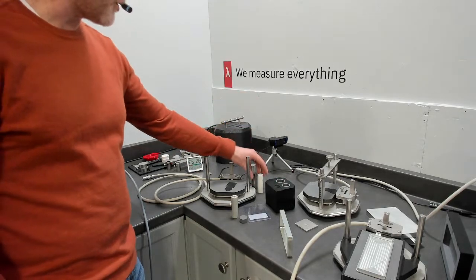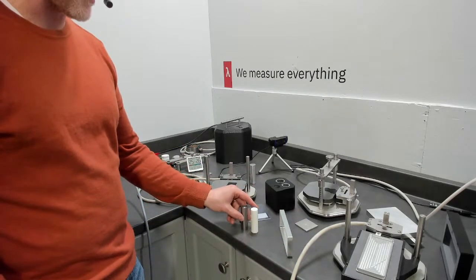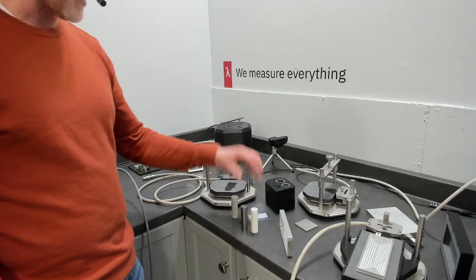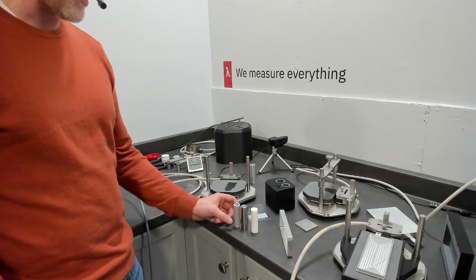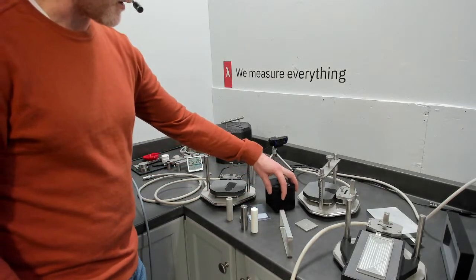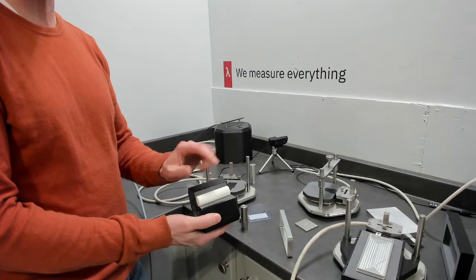The other means of determining accuracy is, just like with slab or pouch type batteries, we can offer reference materials to verify operations. This is Macor, and this is a steel, and we can measure the specific heat of each. These are machined in the exact same shape as a 21700 to give us a very confident dimension. Just like for the battery, we can measure in this configuration and in one dimension and look at how accurate we are.